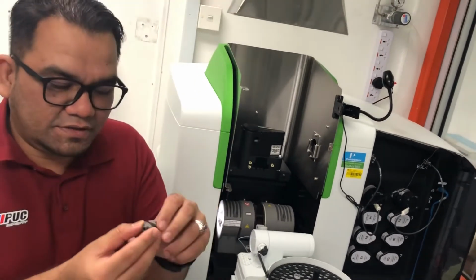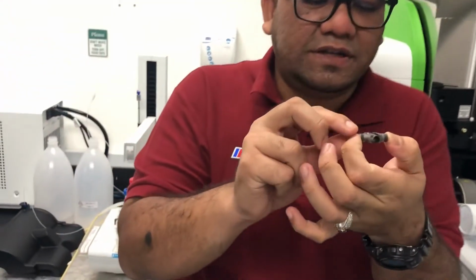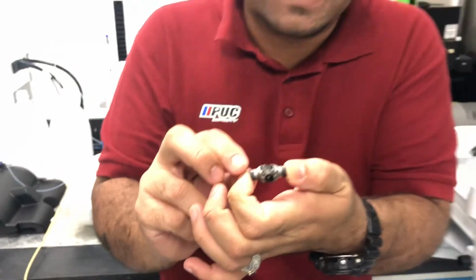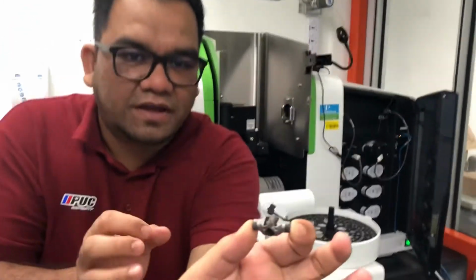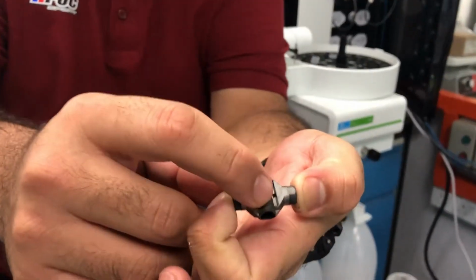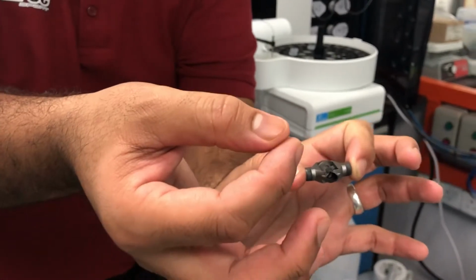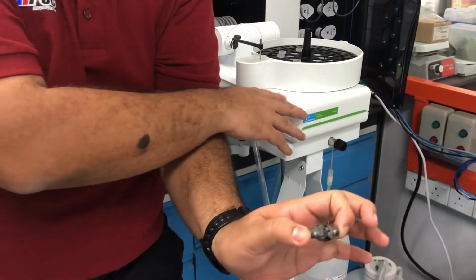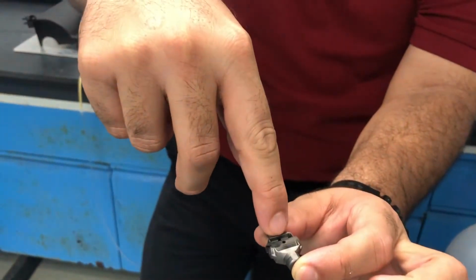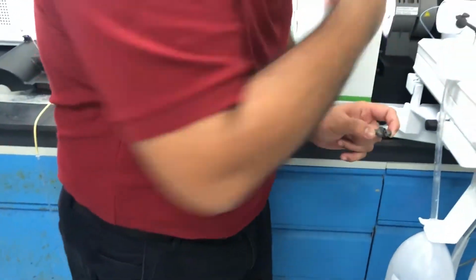And what about the graphite tube? This is the real graphite tube. It's very small. That's why I taught in the class that we only need a small size of sample for graphite furnace system, right? So this is the graphite tube. Okay, come closer, right? So we have a hole up there. So what happened is we will put the sample automatically using the instrument inside the hole at the top of the tube, and the sample will be there and will be heated inside the electrothermal system.